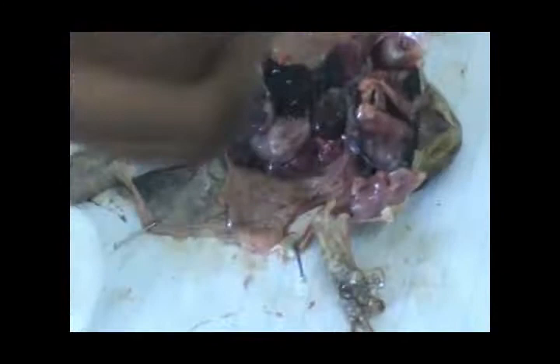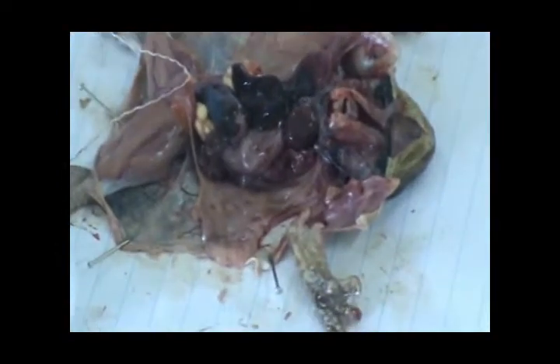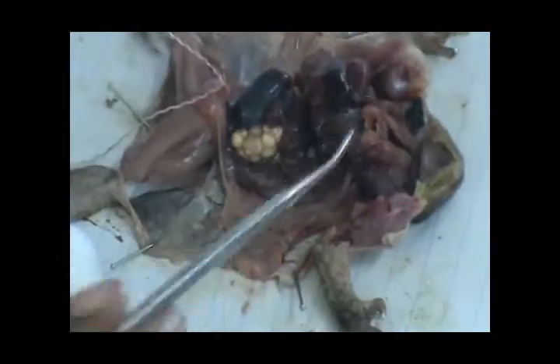Whatever happens on the right of the specimen also takes place on the left — everything is the same, even for the arterial system.